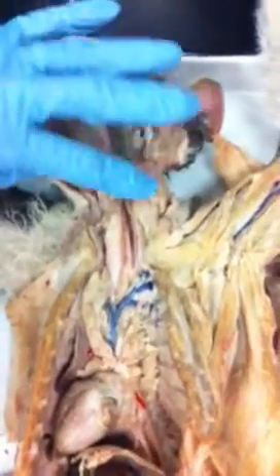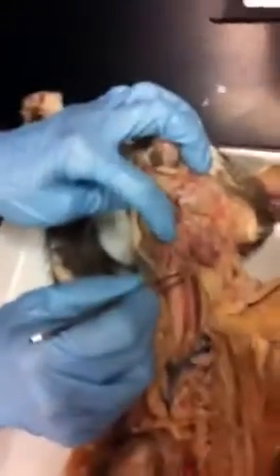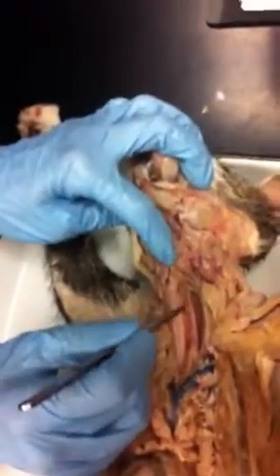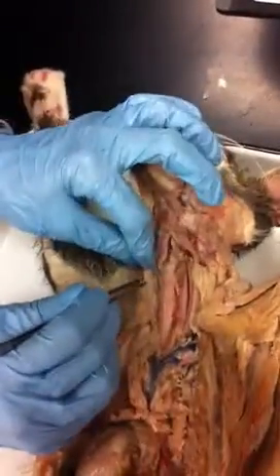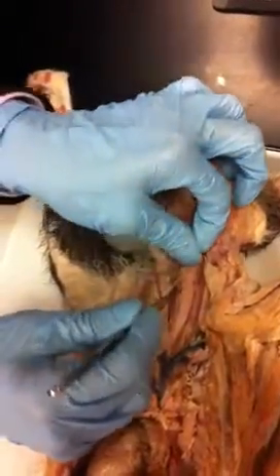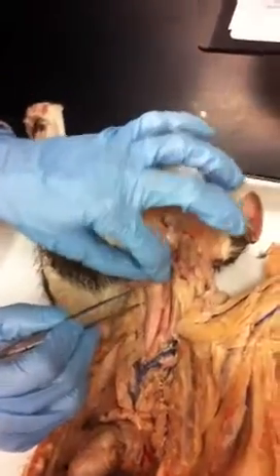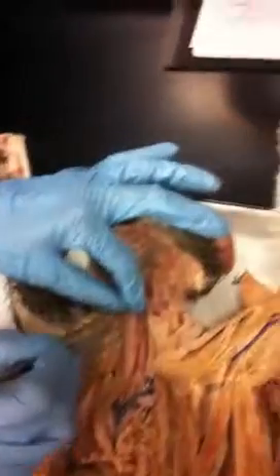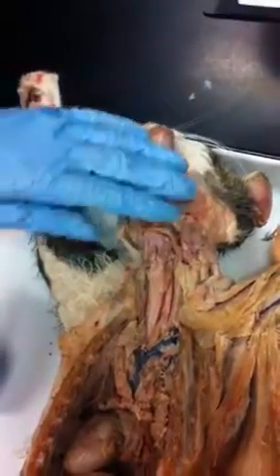I think we have a thyroid gland on the side. Yeah, you do right here. You have one. There you go. They're located just below that thyroid cartilage, and there's one on this side, and then a transverse piece that connects the two of them, like saddlebags sitting there.